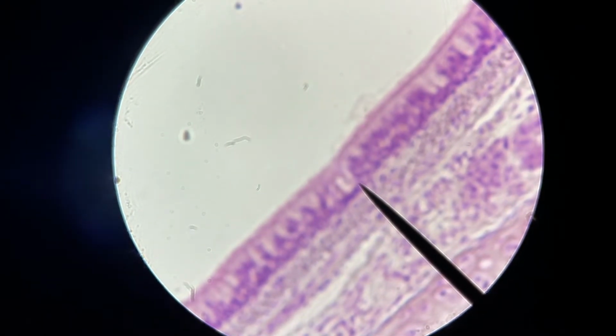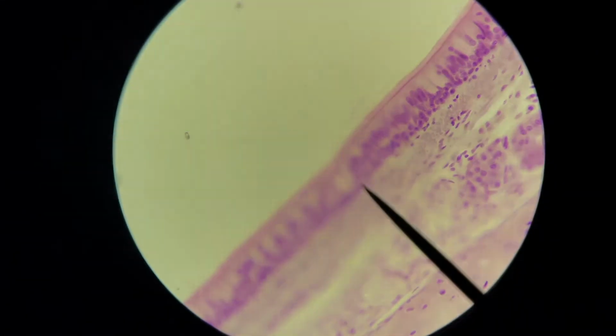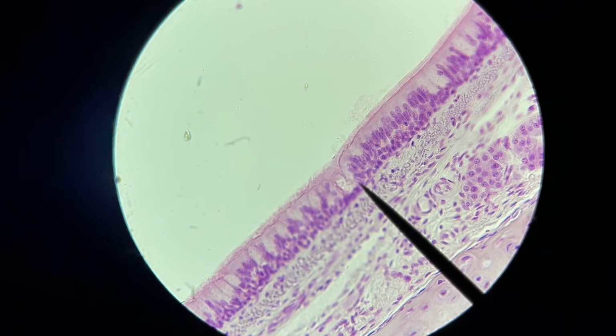So let me see if I can bring this into focus a little better. Maybe create a little contrast here. Okay, so it's not the best, but you can see the cilia on top of the cells. So that's what we're looking for, this tissue sample at the end of the pointer. But again, there are 4 different tissue types in this one sample of tissue on this slide. So you want to start again at the lowest power to give yourself the best chance of success in locating what you're trying to find and focusing it in properly.